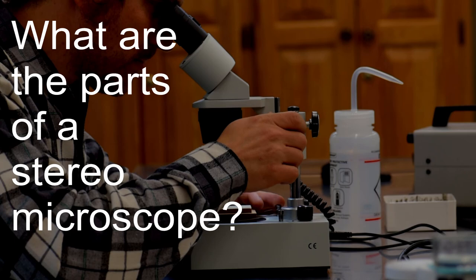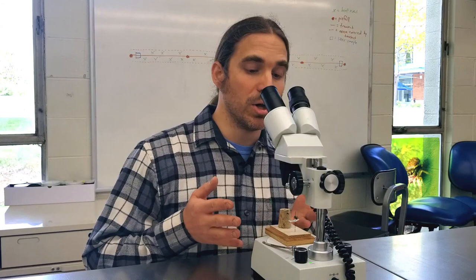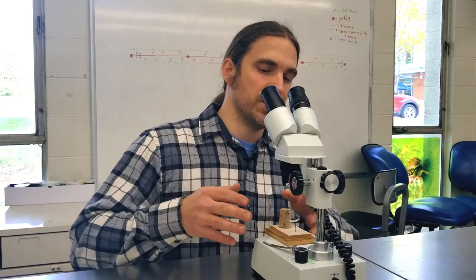There are a variety of different parts to a microscope, all of which can be adjusted to suit the needs of what you're looking at. First, we need to know how to turn the light on. On this model, there's a knob that you just turn on and you can see the light coming down from on top. In other types of microscopes, you might have a flip button or push button.